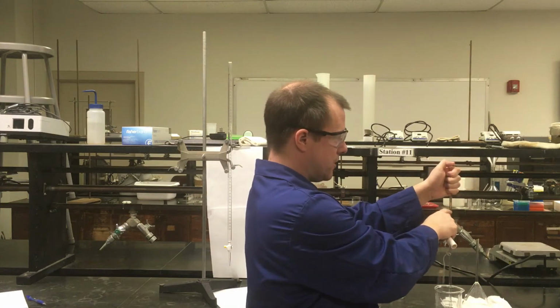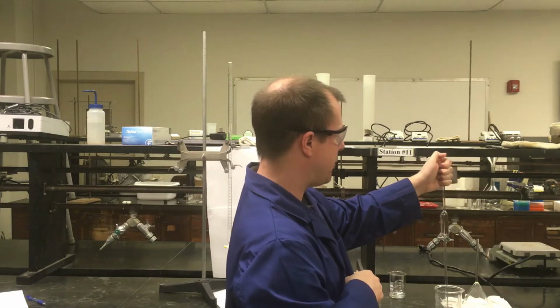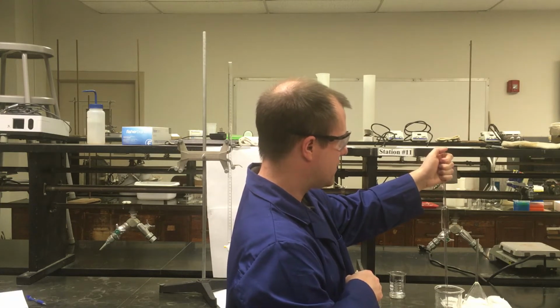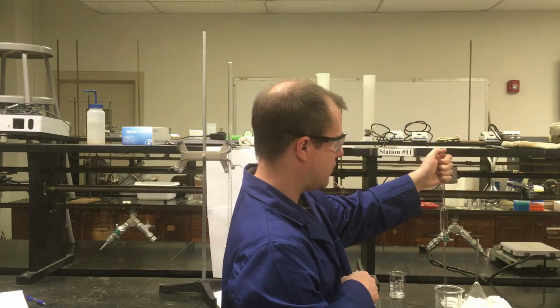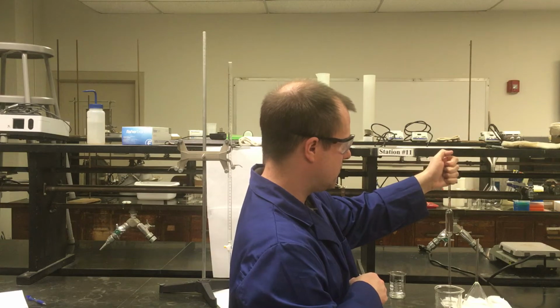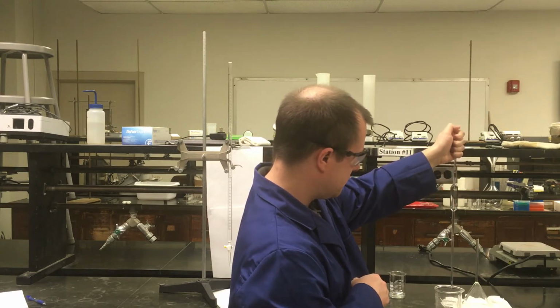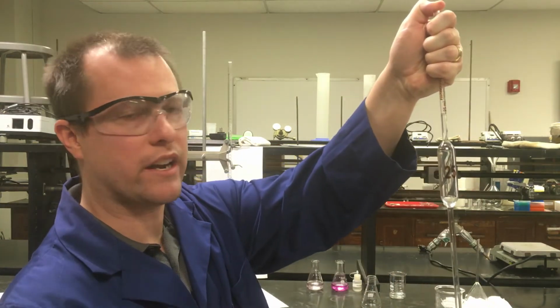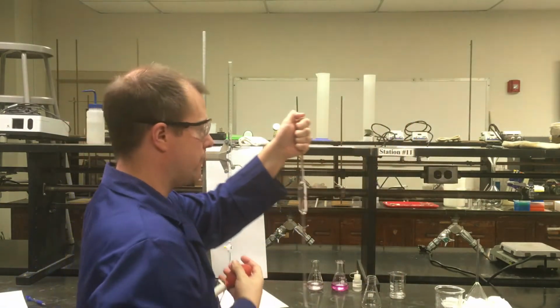So my liquid level's up here, the line's down there. Now with my thumb, I can control easing off the pressure and slowly letting that liquid level get down to the line that I want it to be at. So I'm going to let it drain down just a little bit. Then clamp down. Now if I show this, I have my liquid level, the bottom of that meniscus is almost right on top of that line. Now I have the right volume that I want.